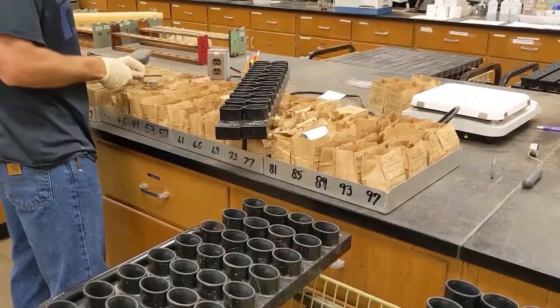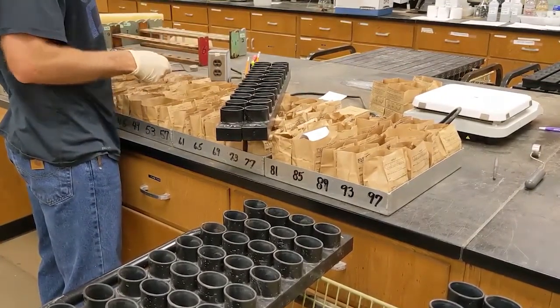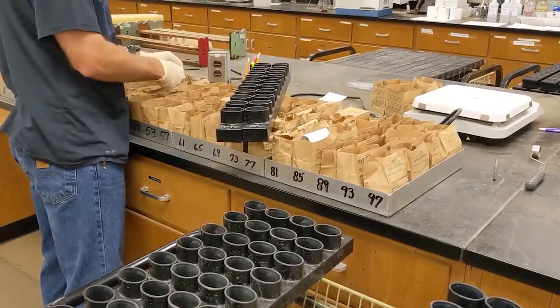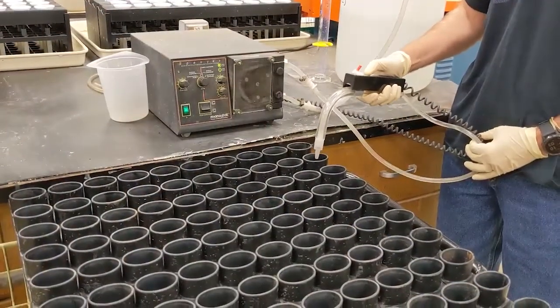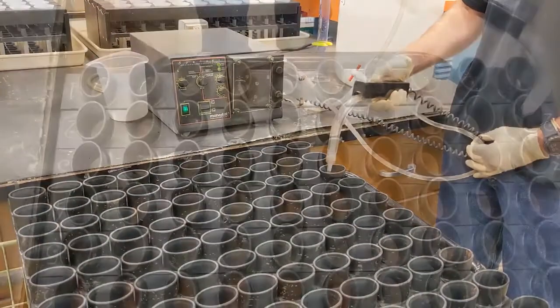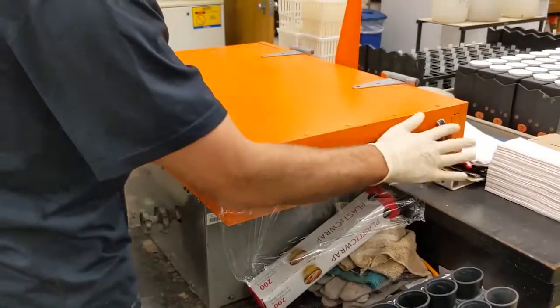Once prepared, 4 mL of each sample is scooped into an extraction cup. The numbers on the extraction cup trays correspond to the lab numbers on the soil trays. 20 mL of acid extract is dispensed into each cup. These trays are extracted in groups of 5 or 50 samples and shaken for at least 5 minutes.